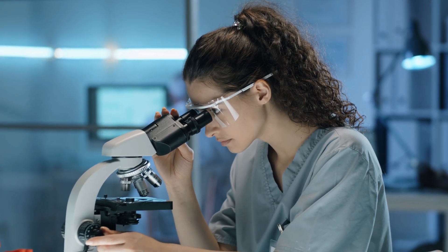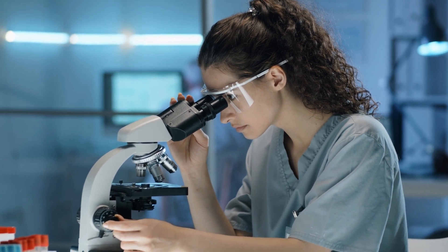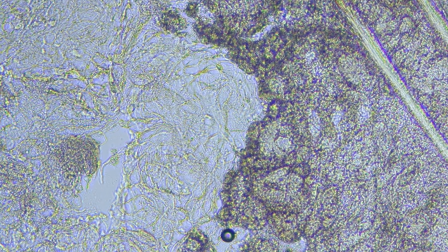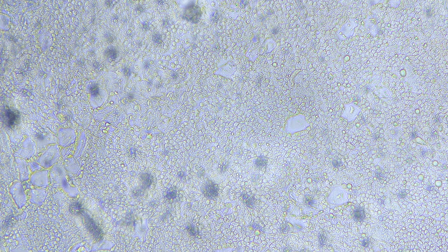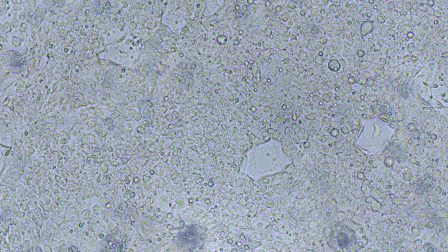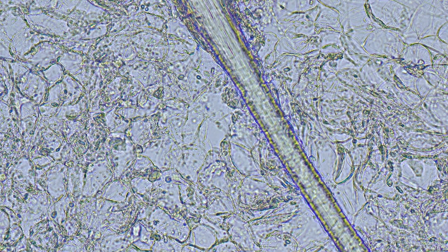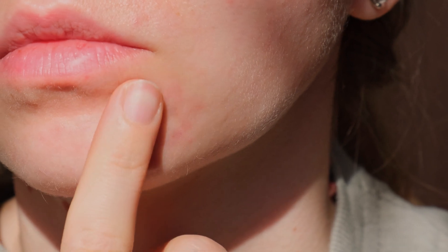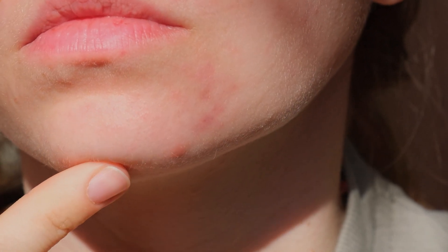To identify which bacteria are involved, let's examine them under a microscope. At 100 times magnification, we can see a large amount of sebum caused by excess oil and dead skin cells. At 400 times magnification, an uncountable population of Cutibacterium acnes bacteria is competing for food. Sebum, dead skin cells, and dirt accumulate, creating an ideal environment for bacteria to thrive, causing internal skin damage without pain. This makes the skin rough and less smooth, which is difficult to detect with the naked eye.